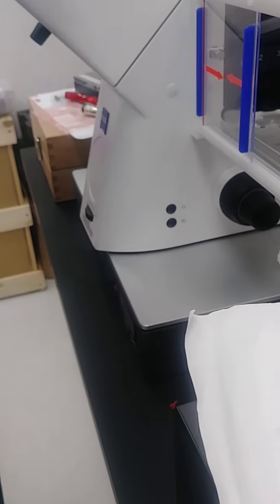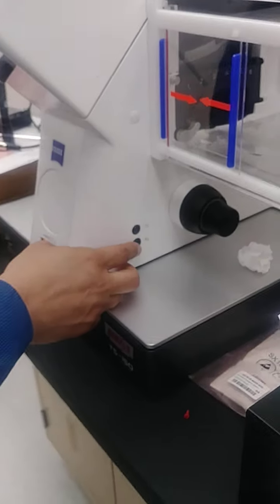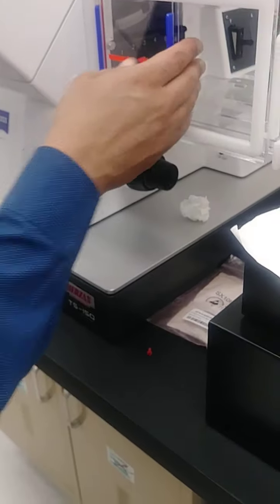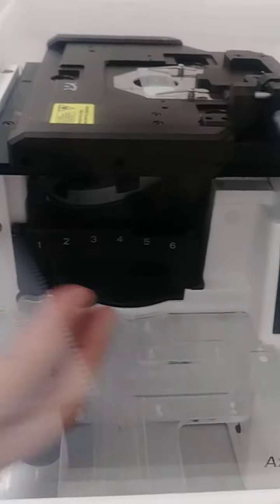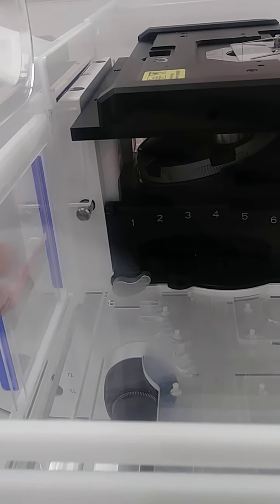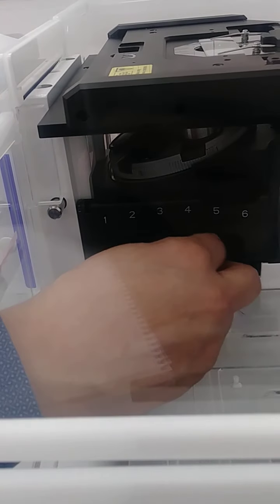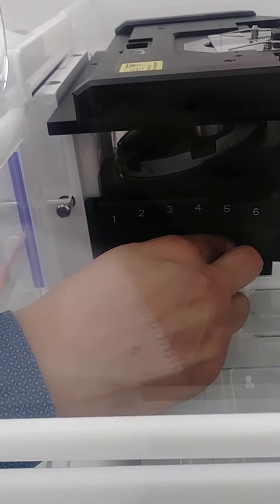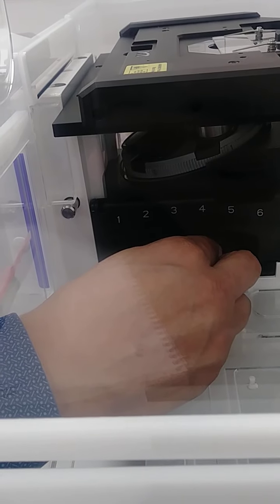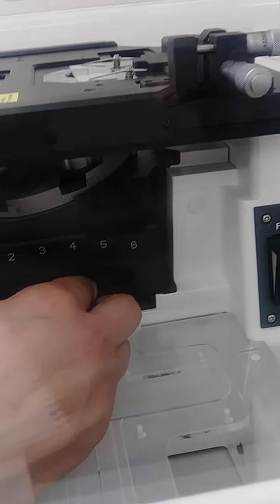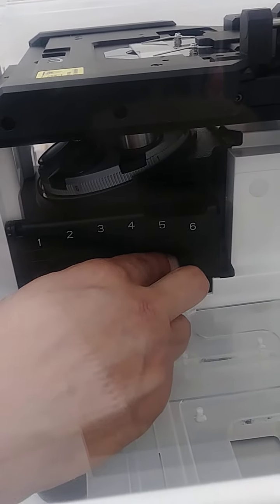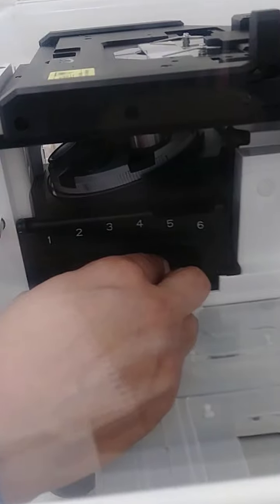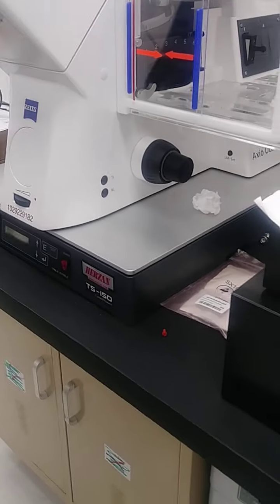So whichever light you want, that's the shutter. And then over here I showed you, you change the filter by switching. So right now, three is red. Two is green. And one will eventually be DAPI when we have the UV light source. And you can see once you change it, the light changes.